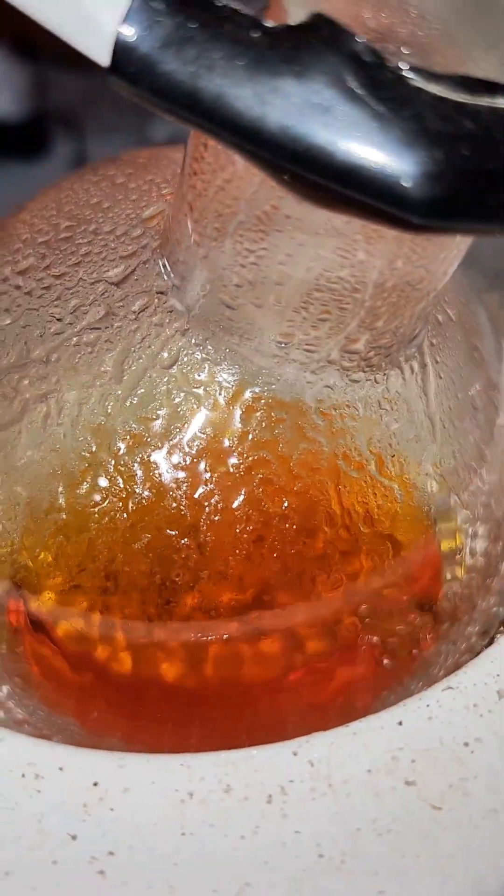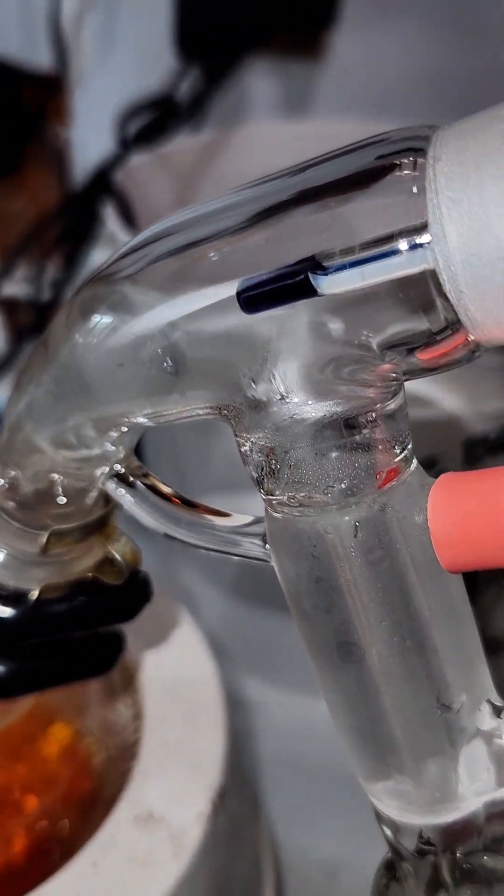This process is pretty quick because benzene is a really low boiling solvent, and it should get rid of this orange color.